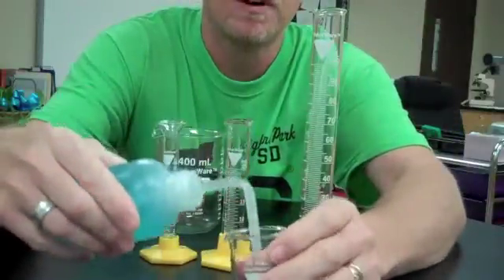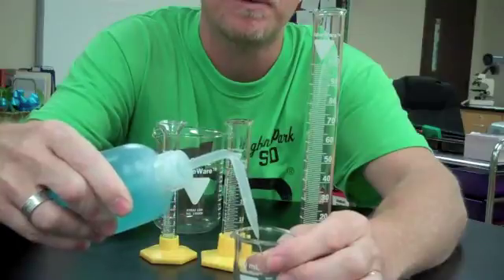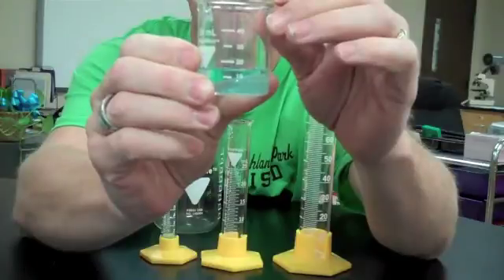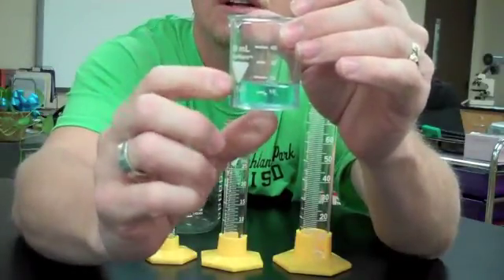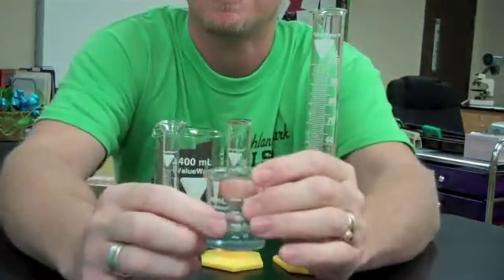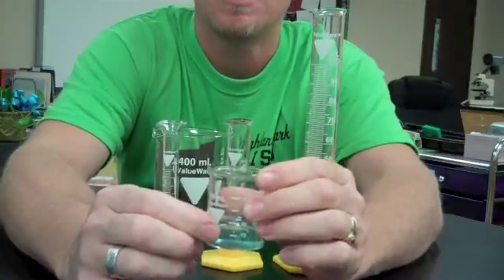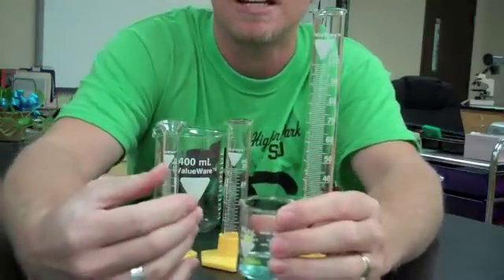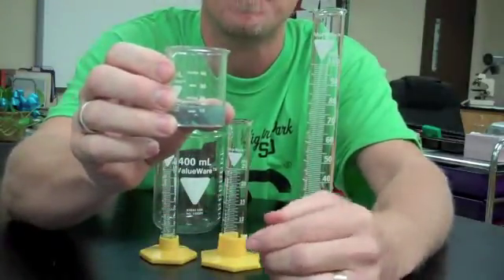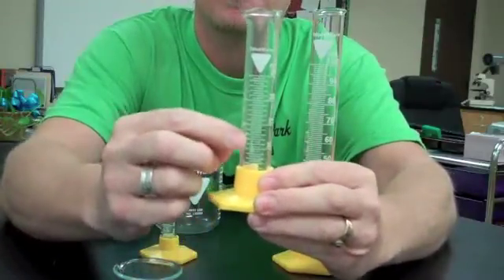For example, if I were to put this water - this is just water with some food coloring to make it show up a little bit better - into the beaker, we notice that the volume of liquid falls between the 10 and the 20 milliliter mark. So we are left to guess what that might be. If it's halfway in between, you could say that's about 15. But notice my language - I said it's about 15. I'm not positive that it's 15.